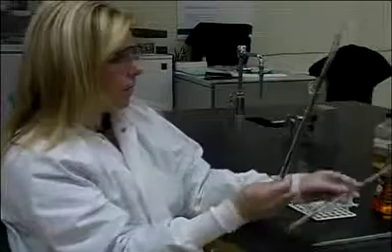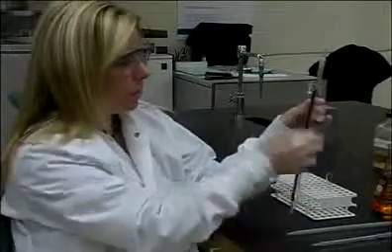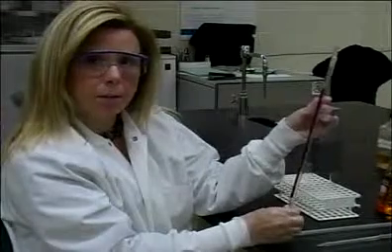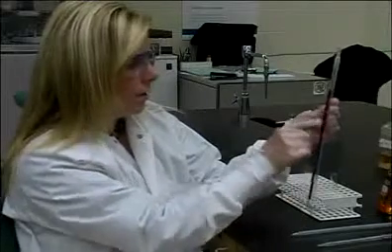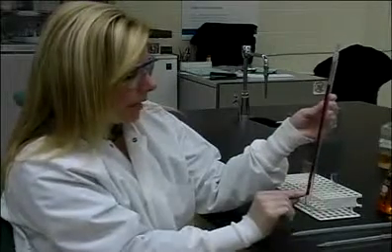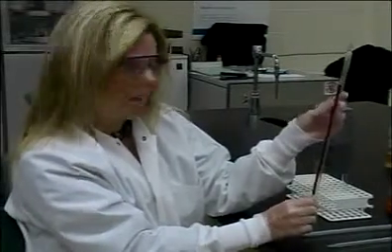This next pipette is also a serological pipette. As you can tell, they both have the same skinny shape. However, this is not calibrated to the tip. Again, we have 0, but 10 ends right here at the bottom. It does not go all the way to the tip. So hence, this is called a mohr pipette. If you dispense more than the 10 ml marking, you're going to get more volume, hence the word more.